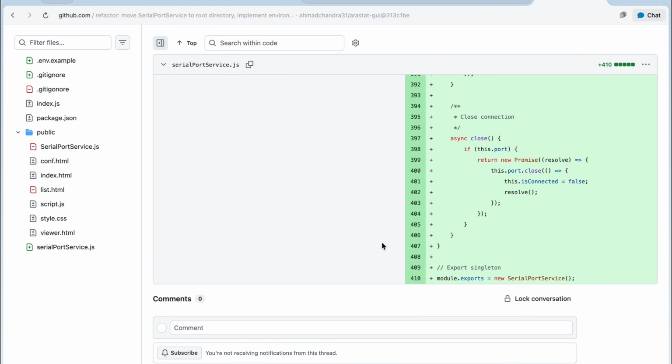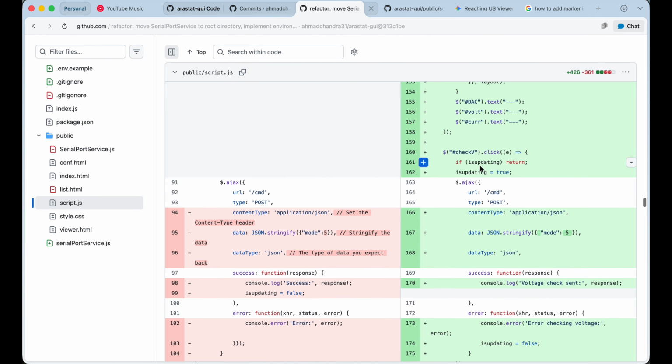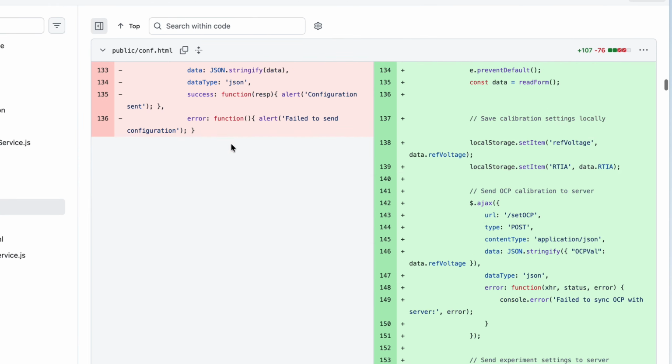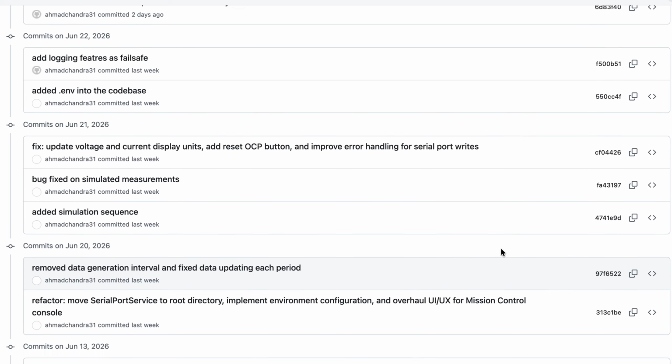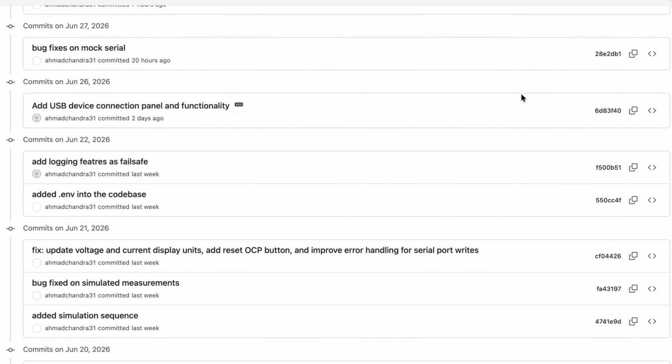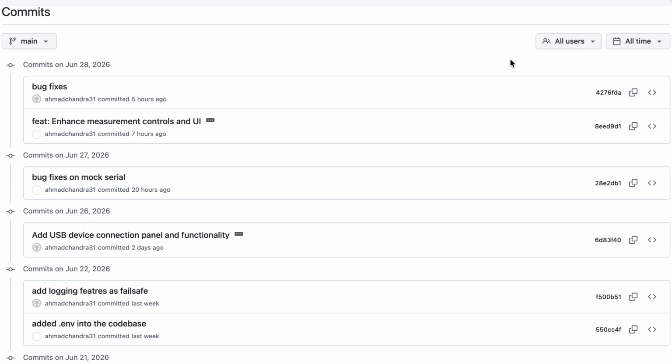Despite all that, the AI isn't perfect. Some of our critical logic was removed, so we had to patch it on our own. After understanding the flow and the code and adding more improvements to our codebase, the app is finally way better and more maintainable. Some capabilities are still underway, but it's working.